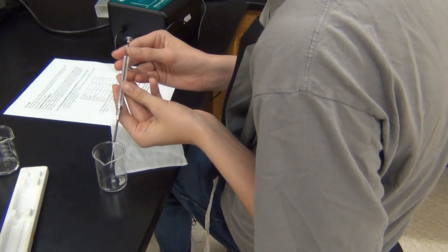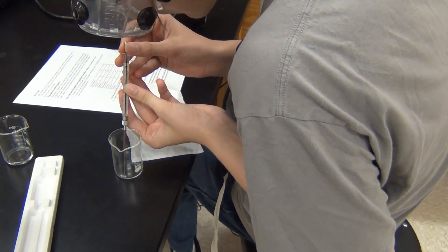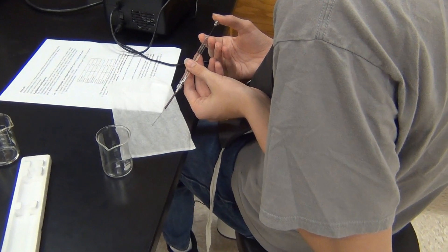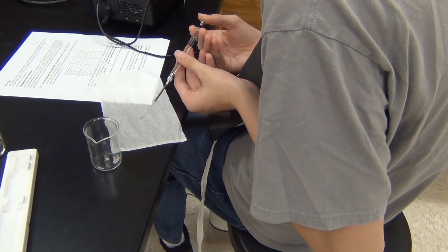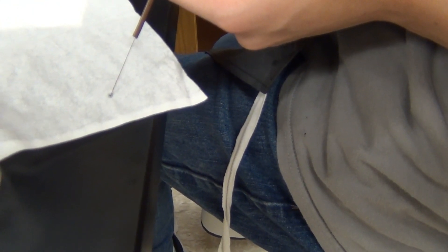In between each run and each sample, we are rinsing the syringe carefully with a couple of microliters of acetone. We pull it up, and because it's such a small amount, it doesn't even really become a droplet. We're using the Kim Wipe to help wick the acetone out of the needle. You can see just a tiny little wet spot appears.